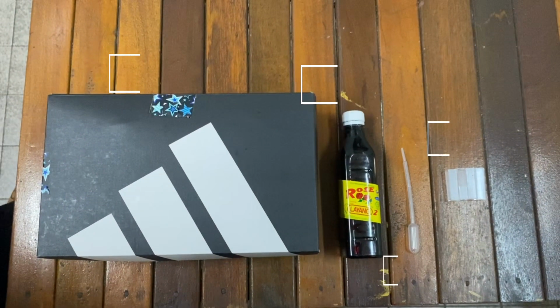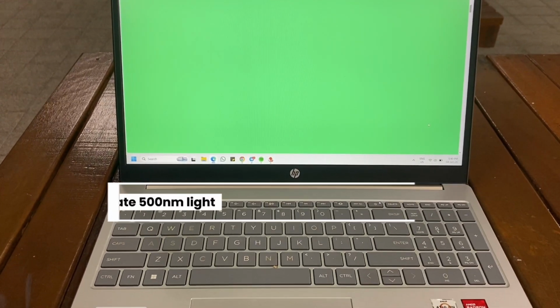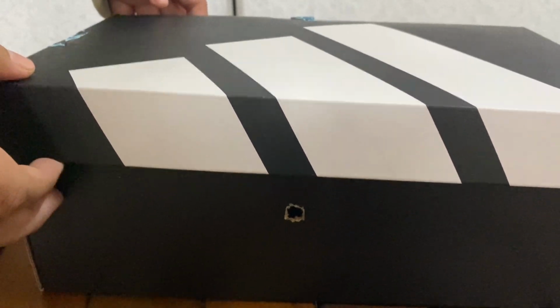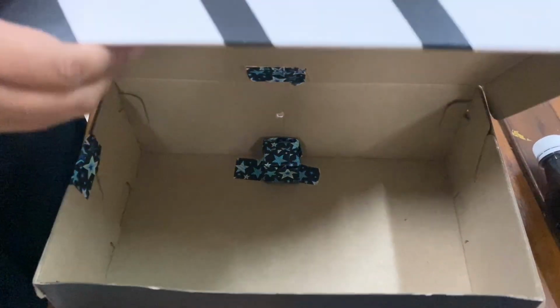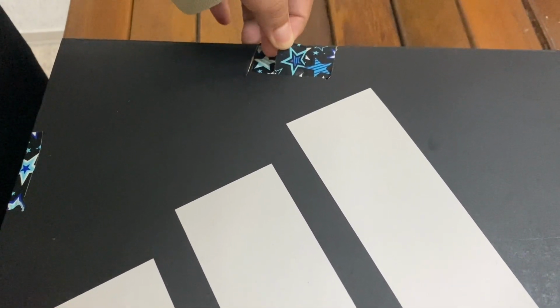We use a black box, rose syrup, cuvettes, and a dropper. We use a green backlight and tune it to approximately 500 nanometer light, and this is the link. We made two holes at the front and also at the back of the box. Also, we made an opening on top of the box.